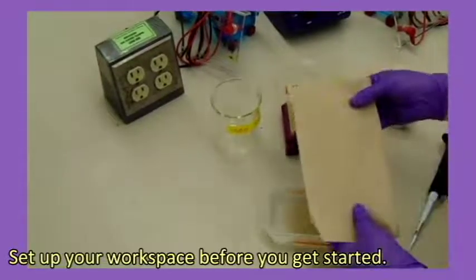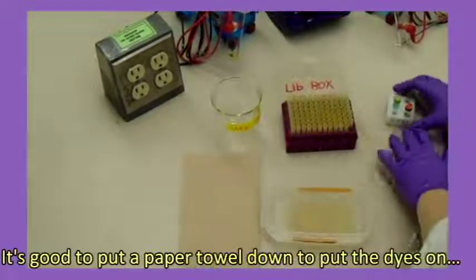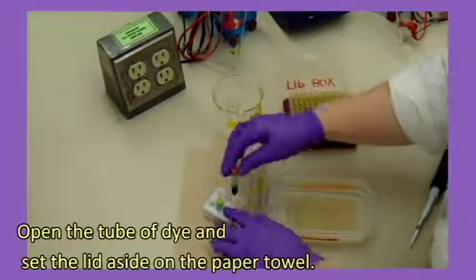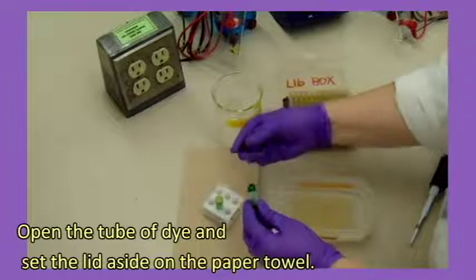Set up your workspace before you get started. It's a good idea to put a paper towel down to put the dyes on to keep from making a mess. Open the tube of dye and set the lid aside on the paper towel.